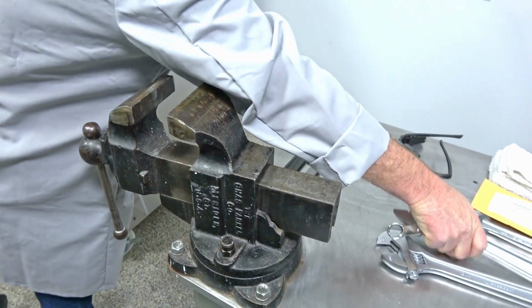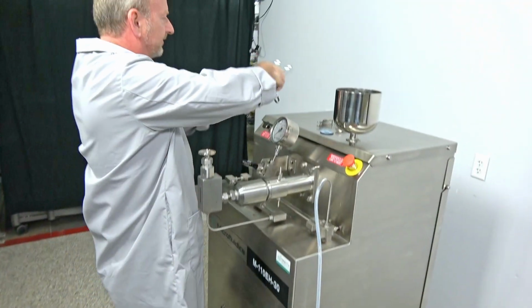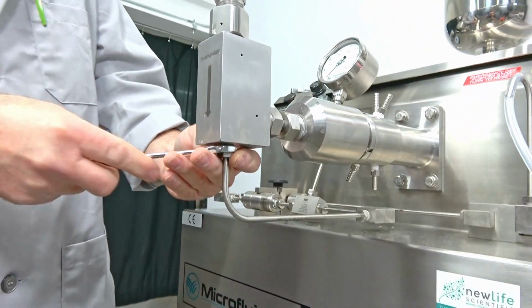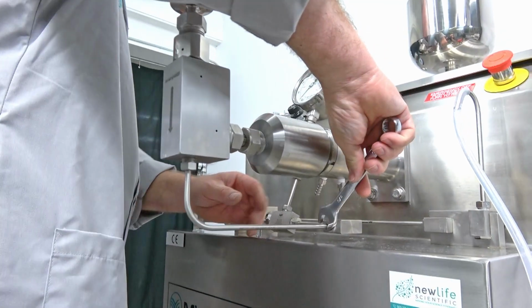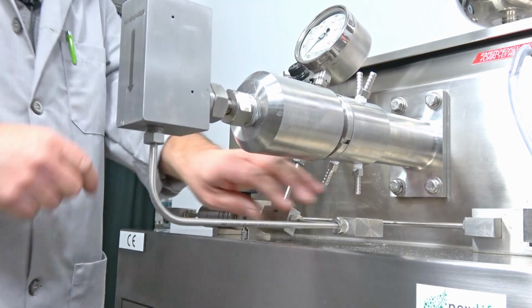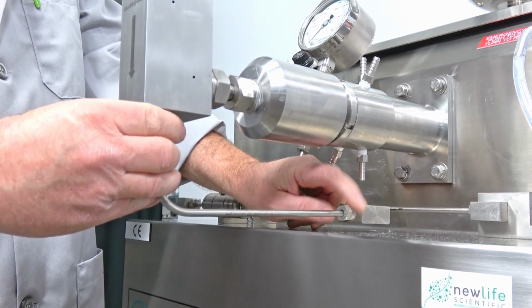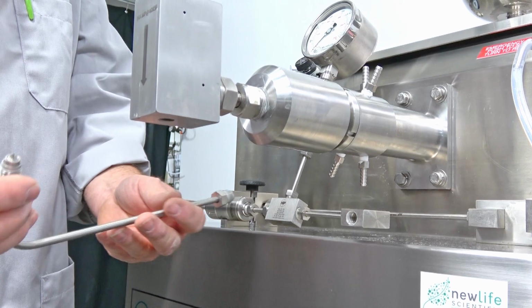and we're going to grab some wrenches and bring them over here real quick. First thing I'm going to do is just remove this line here, and that's where the 5/8 inch goes. So just loosening it there, loosening it here. And once you get them loose, they're very easy to unscrew because they've got some lubrication on the threads, so that it's set up so that you can remove parts and clean them.